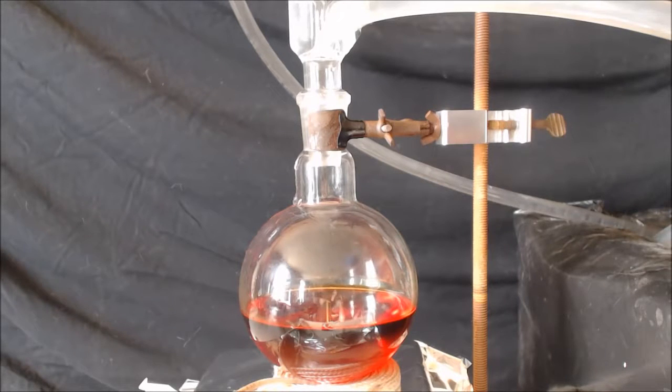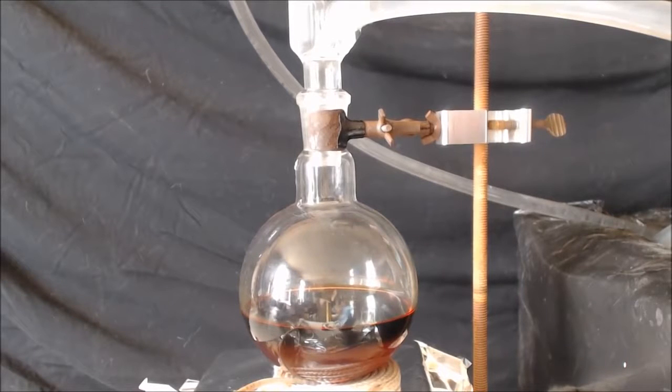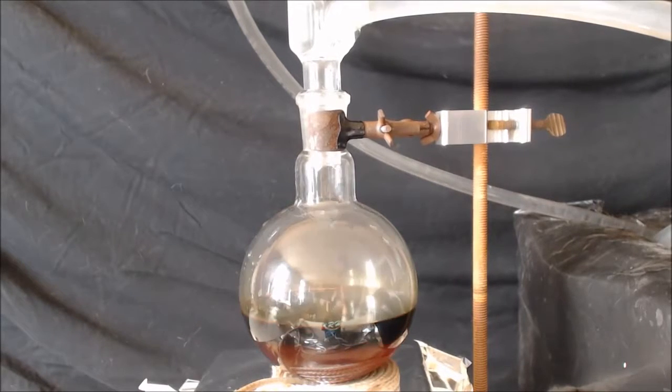This time I don't care if it over-oxidizes, so I don't care if it's surrounded by oxidizer. Before when I was trying to make an aldehyde, I didn't want to surround it all by oxidizer so it definitely gets oxidized twice. I'd rather do it the other way around.